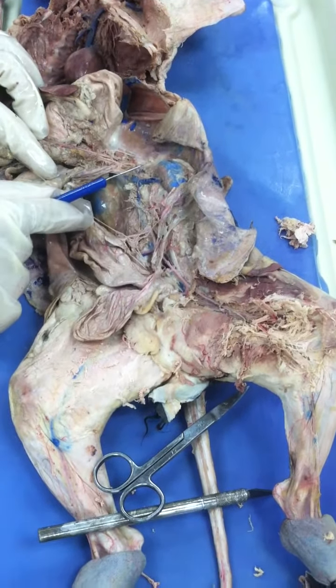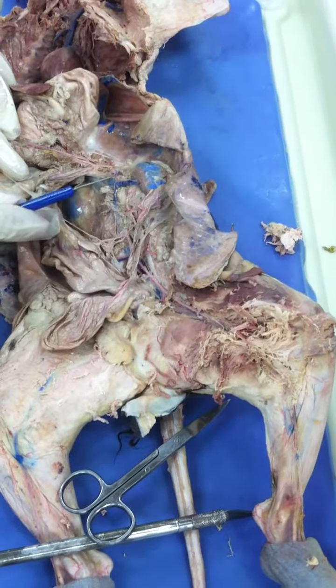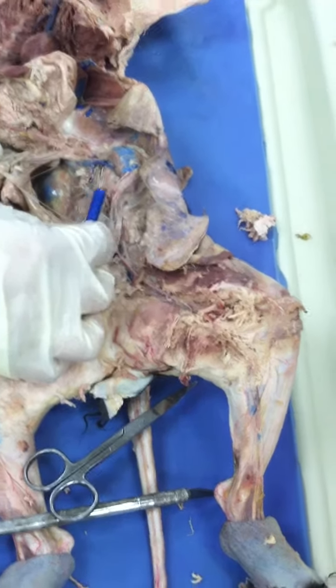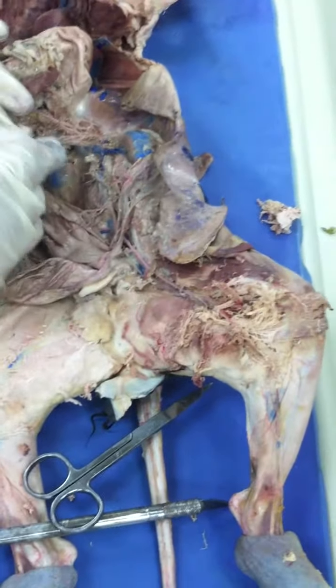Adrenal lumbar. So it's going to be the adrenal lumbar vein, right? Now, immediately we're going to see this structure. What is it? So then this is going to be the renal vein. You see how it's going towards the kidney? Now here we also going to have, this is going to be your left renal and your right one.